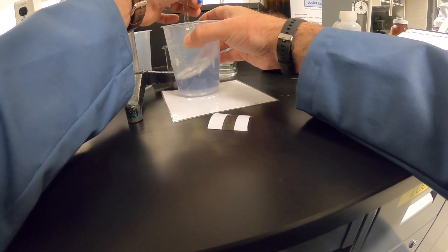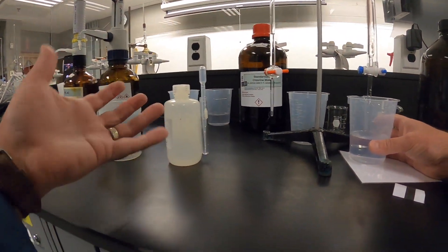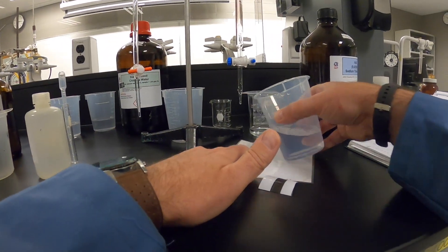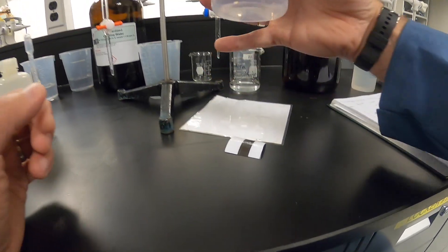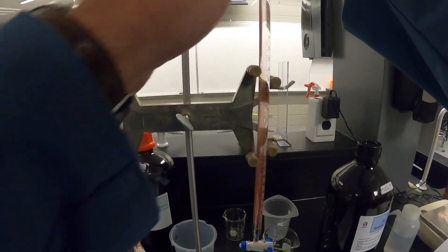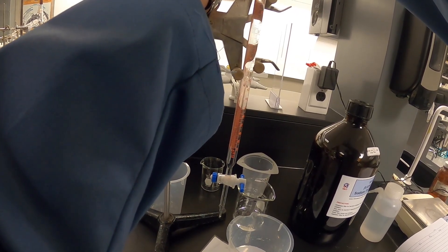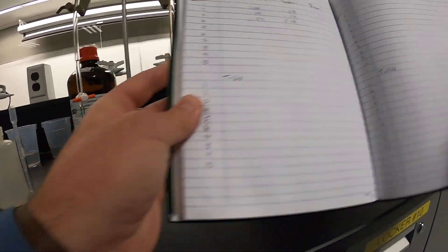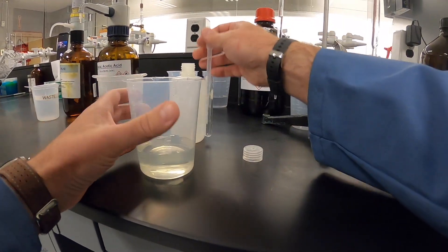Every now and then when you do this titration, the addition of the starch can cause little particles to precipitate out. As you look at the color, sometimes the particles will actually hold onto the blue. We have to look beyond those particles and look at the solution itself. This volume is quite a bit more now — 5.50 mL.